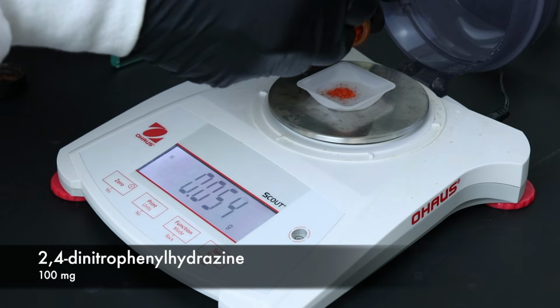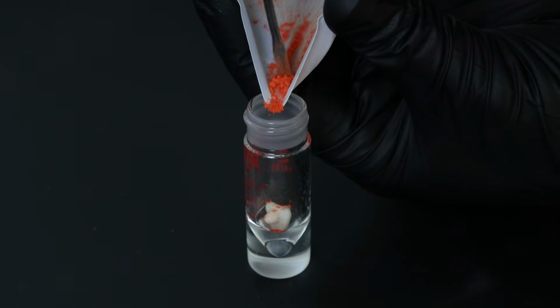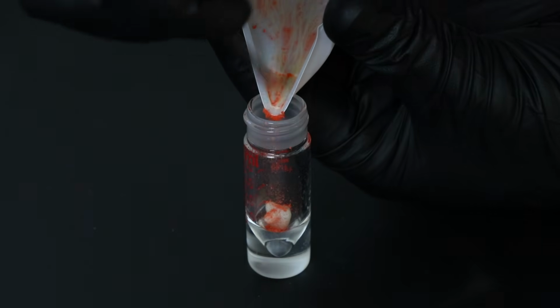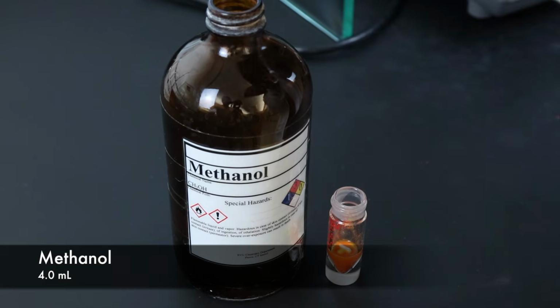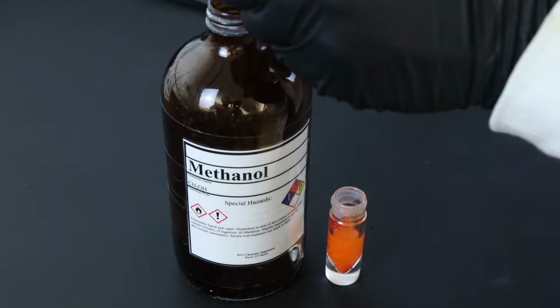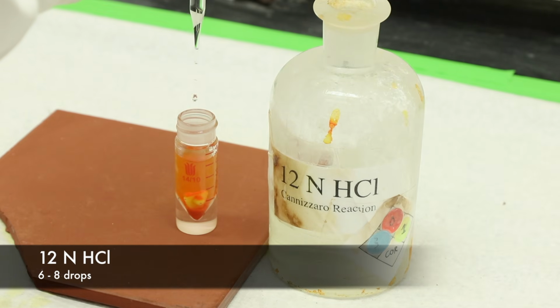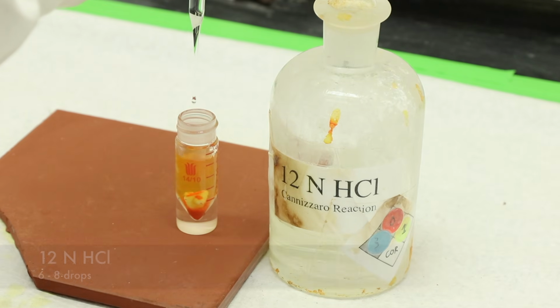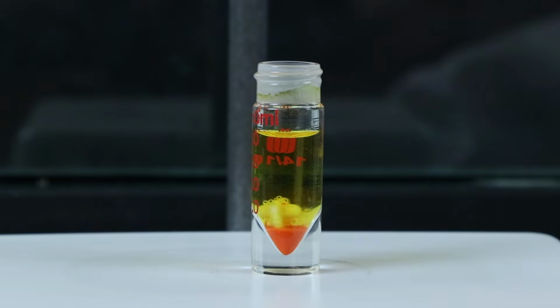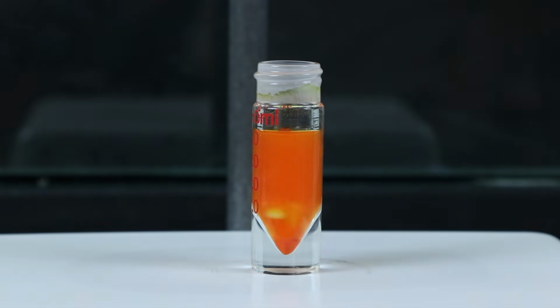So I'll weigh out 100 milligrams of the dinitrophenylhydrazine and add that to a 5 milliliter conical vial with a large spin vane. Then I can add 4 milliliters of methanol and 6 to 8 drops of the 12 normal hydrochloric acid. I'll start to stir that to get the dinitrophenylhydrazine to dissolve in that solution.